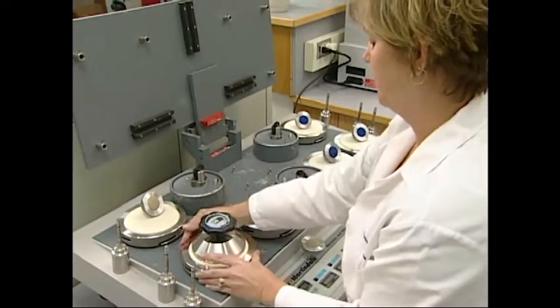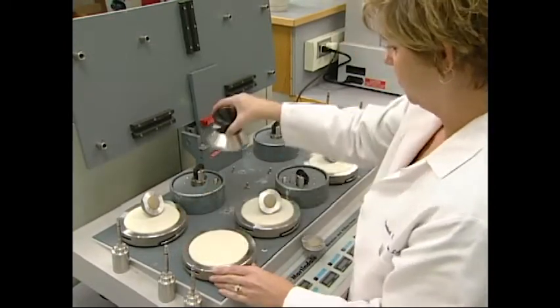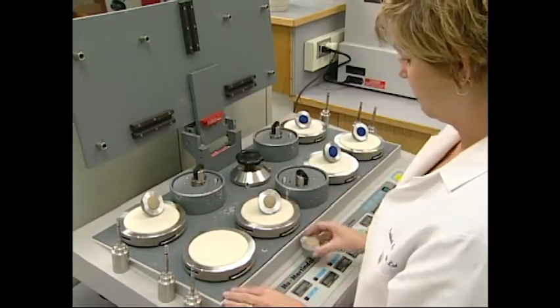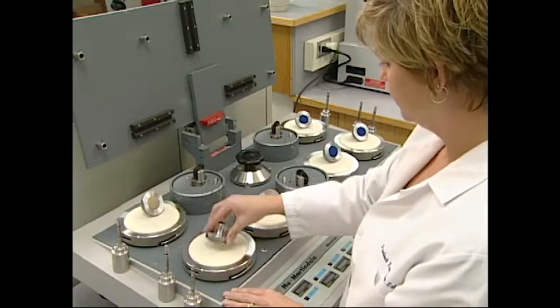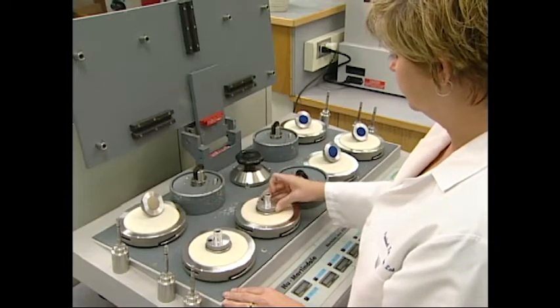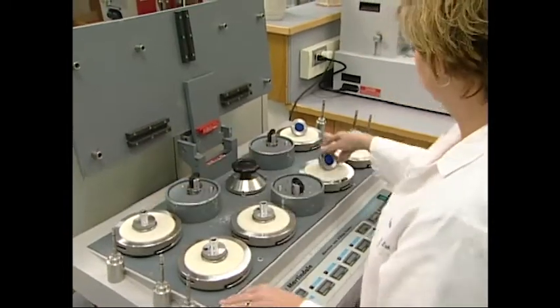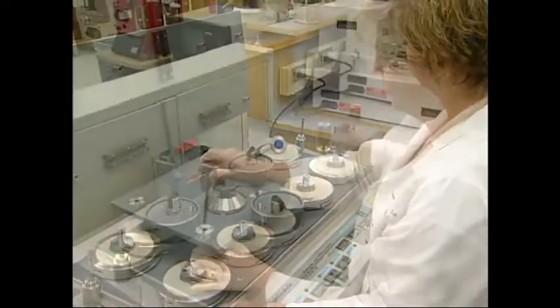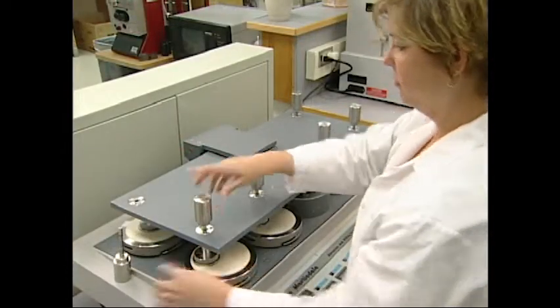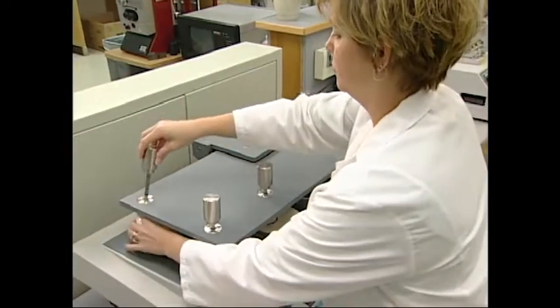The operator has to be aware of the particulars of setting up the machine, and exercise good judgment as to when the test is complete, as to point of failure, and to apparatus setup as the test progresses. Therefore, abrasion resistance testing gives a general evaluation of the product's durability.